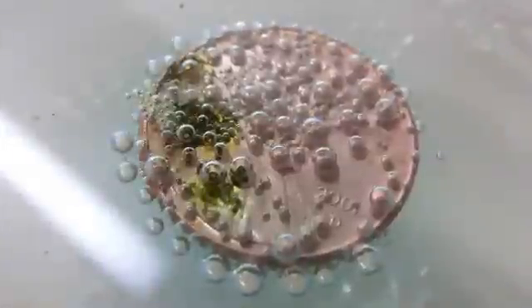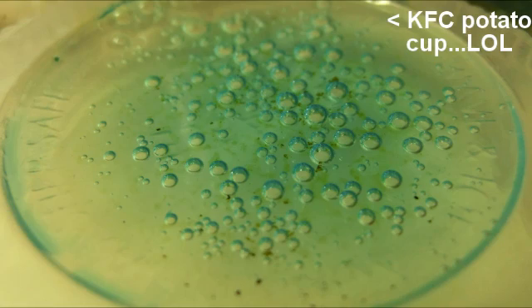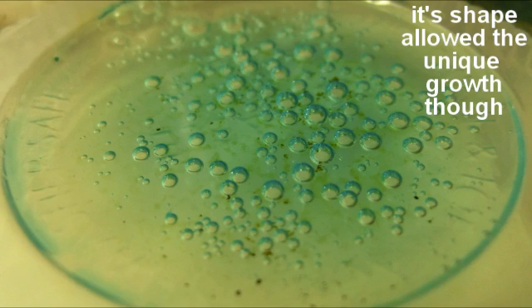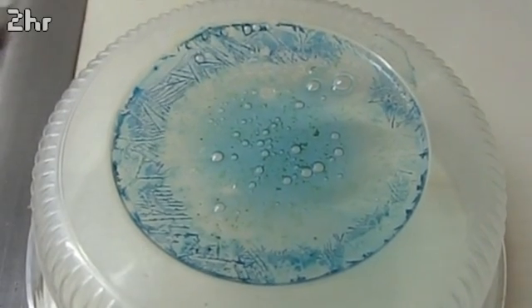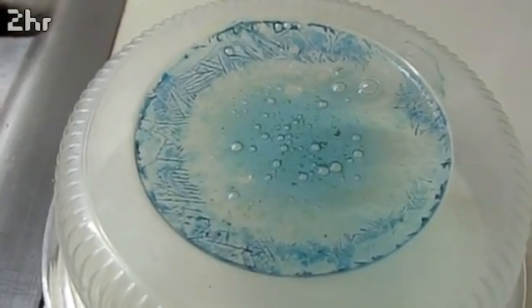Okay, so this is a pretty well-known reaction. Put a penny into acetic acid and hydrogen peroxide and you get this solution. After a while, you can see here the leftover copper acetate solution when it started to evaporate away.